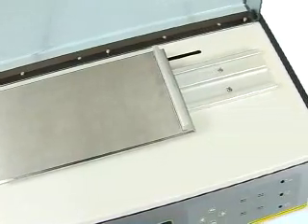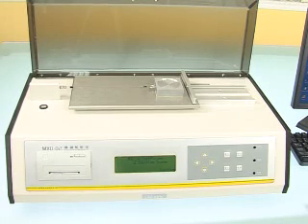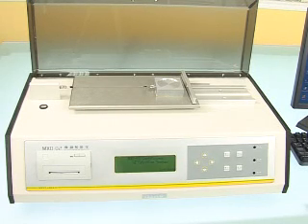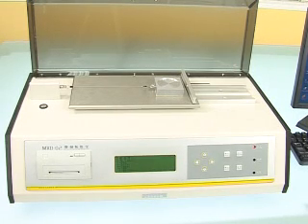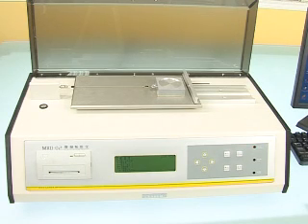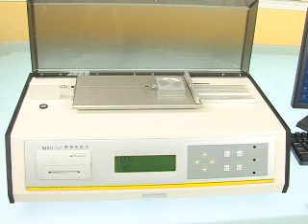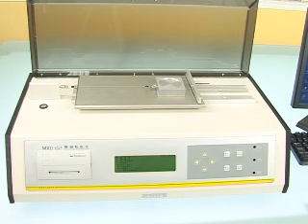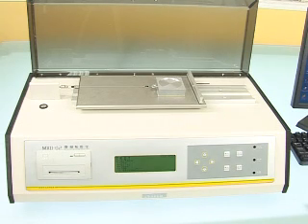Kinetic test, static test, and combined kinetic and static test are selectable for users. Analysis and processing of test data from single or group tests is supported. Reports can be printed in different modes.